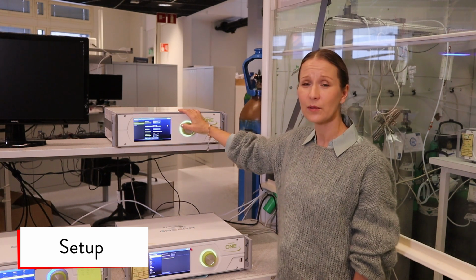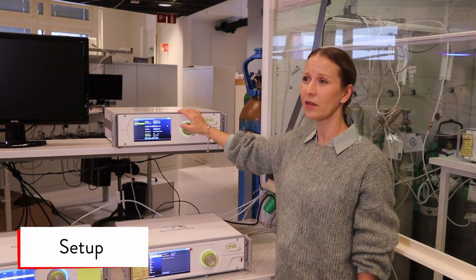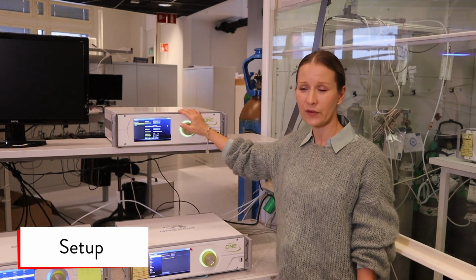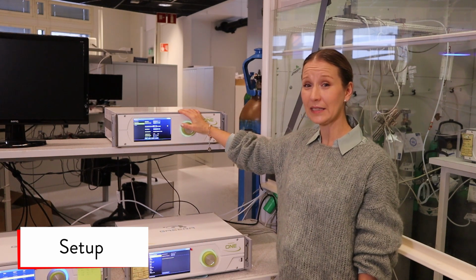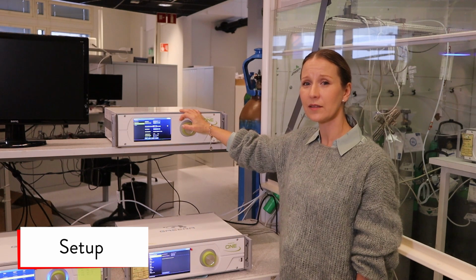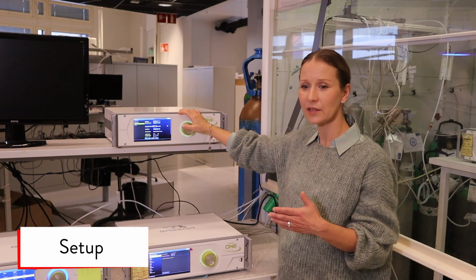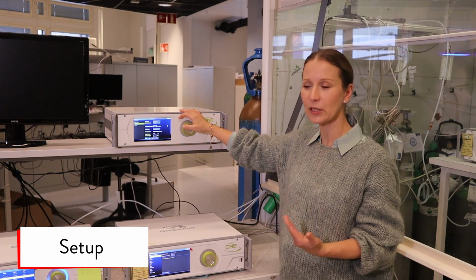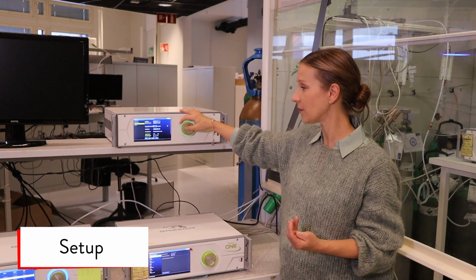Measurement interval, which means that normally the normal iteration time for our device is between 35 seconds and 2.5 minutes. But with this measurement interval, you can select the time in seconds when you want to start a new measurement, like if you want to have a measurement point once in 5 minutes.